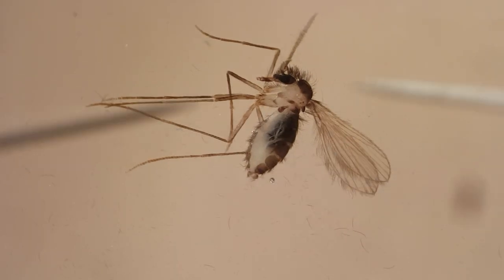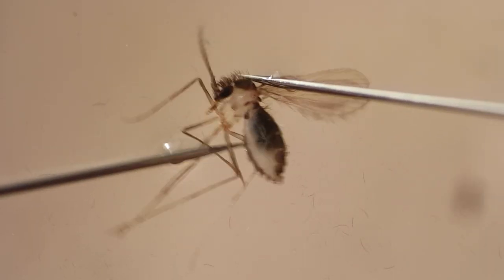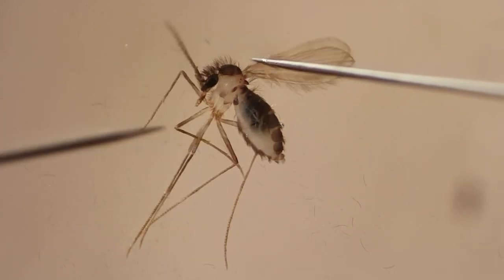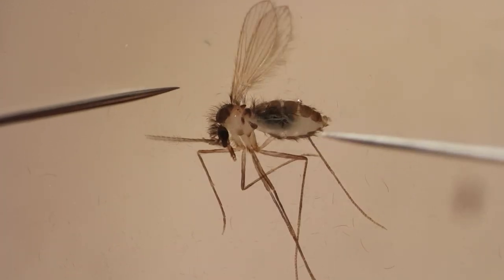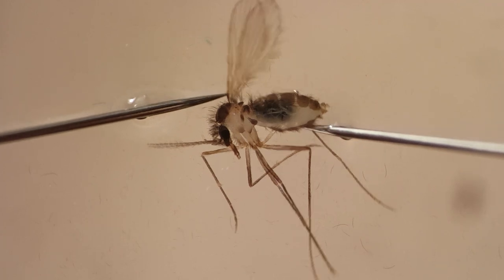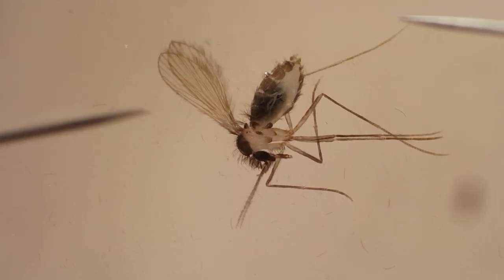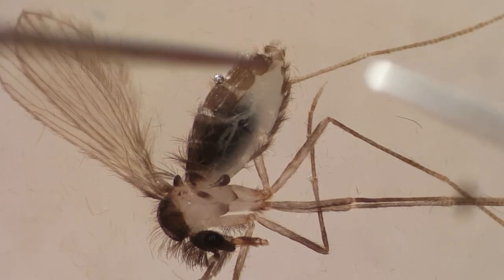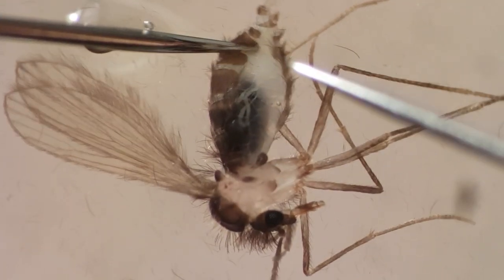Once the fly is on the slide, use dissection needles to set it sideways. Put its posterior facing towards your dominant hand. Then, using your needle, cut the last two segments of the abdomen.